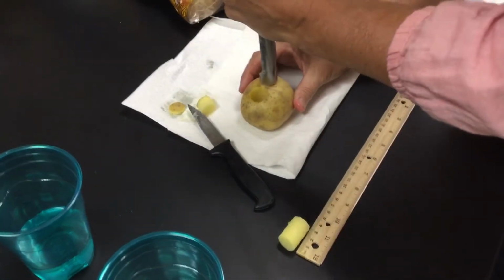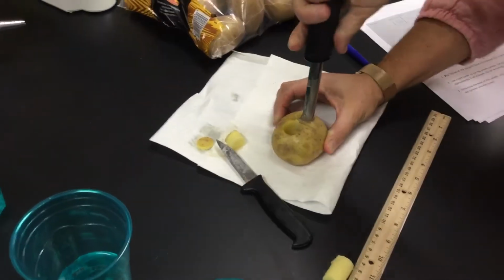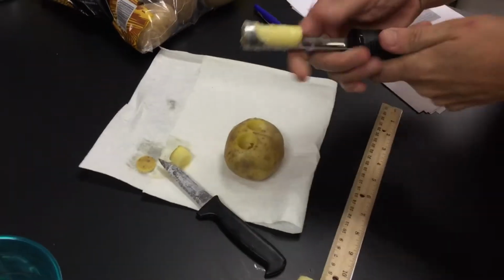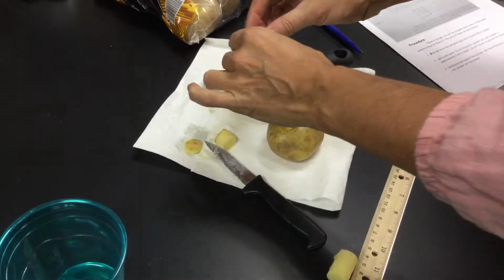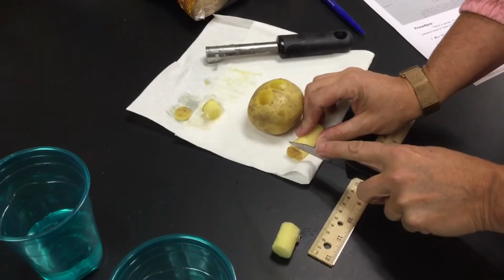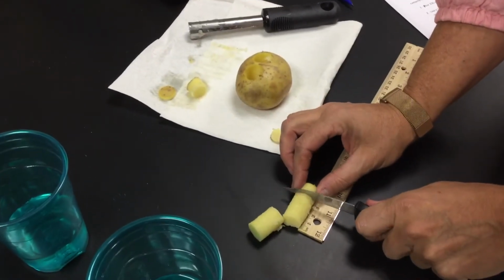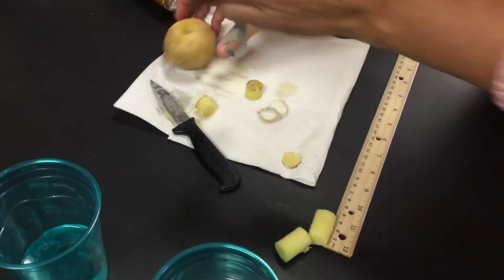We need a whole bunch of these. These we did not make early for you guys because I didn't want them drying out too much. So give me a second. We need 6 potato plugs. They should pretty much be the same. They're all the same brand of potato, the same species, the same size plug. Cutting the skin off of one. We're going to make them all 3 centimeters. If they're not exactly 3 centimeters, we'll be like, okay.